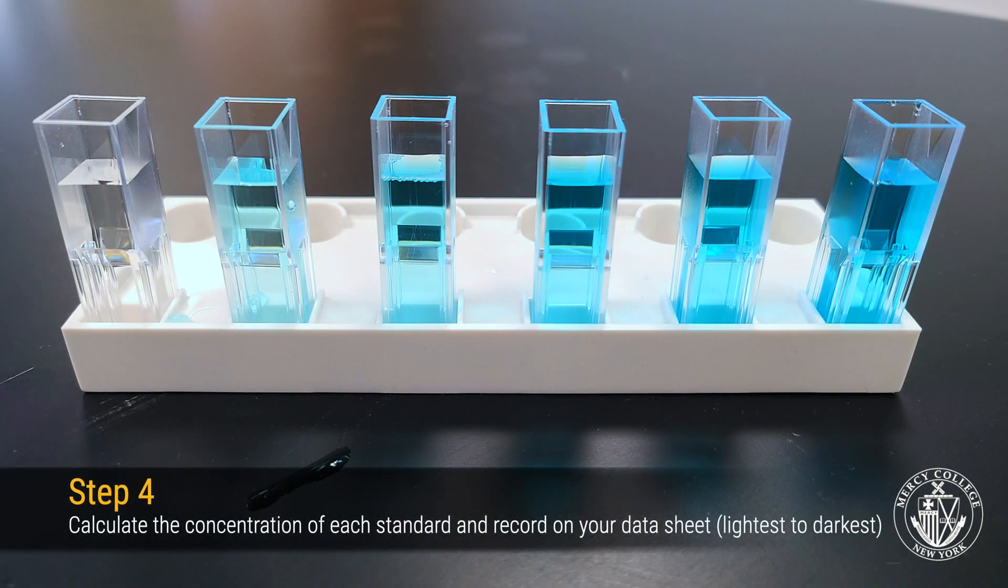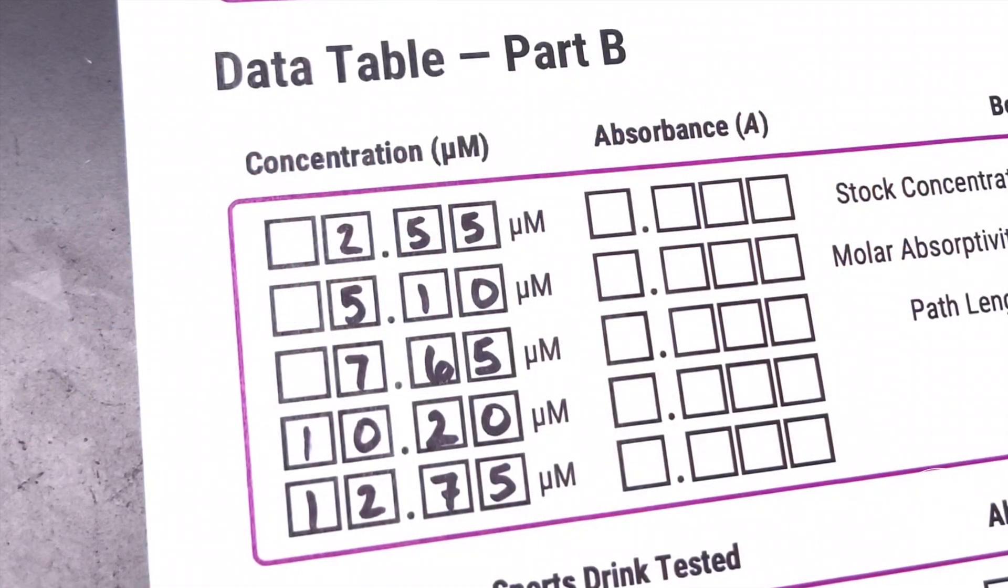Once you're done preparing your standards, you need to calculate the concentration of each solution and record that on your datasheet from least to most concentrated.